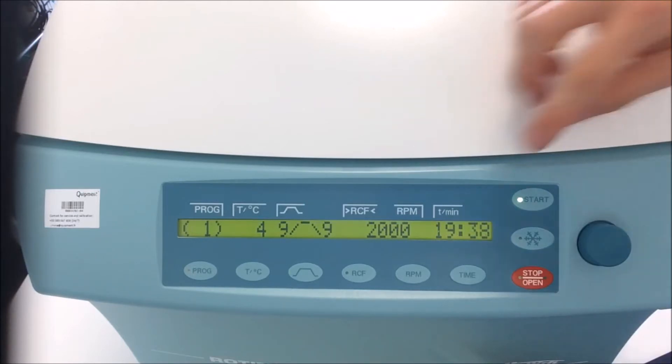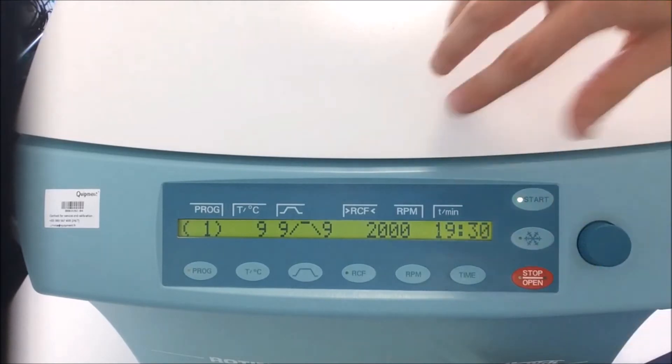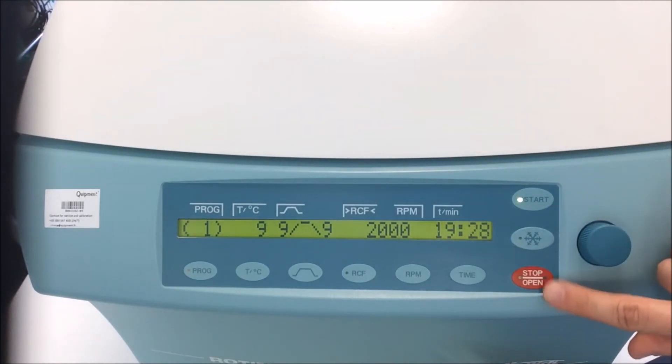Normally I should wait for 20 minutes for the centrifugation to stop. But I'm not very patient, so I will just stop it using the stop key.